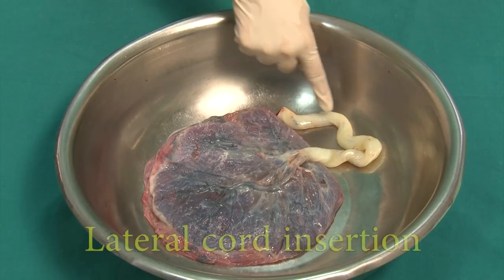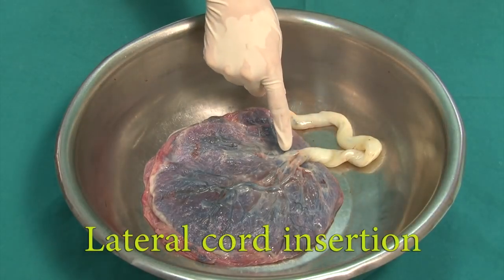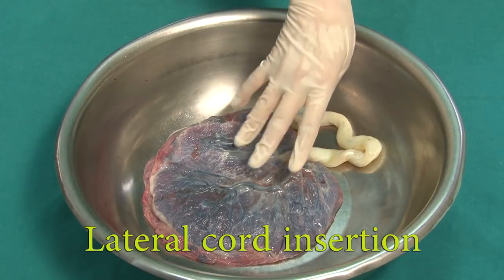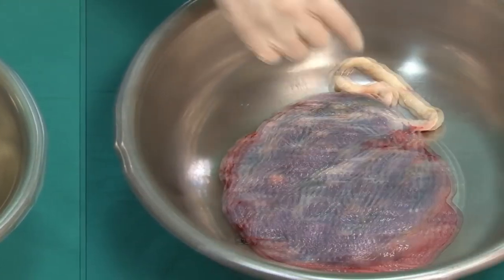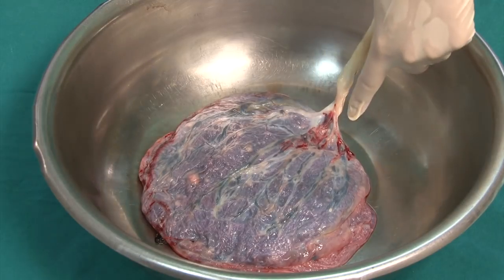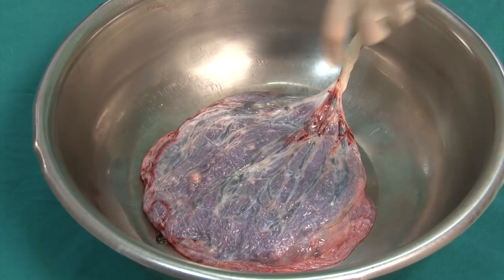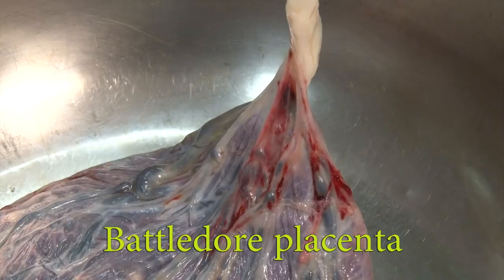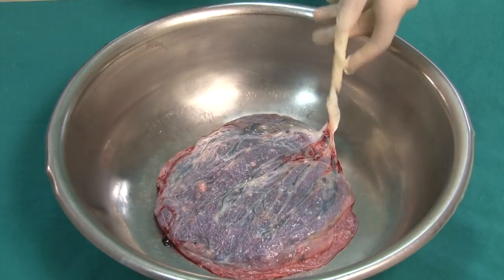This is a case of a lateral cord insertion, which is a variant to the central or slightly eccentric insertion. The vessels from here spread evenly into the rest of the placenta. In fewer than 10%, the insertion of the cord can occur at the margin of the placenta, which is referred to as a battledore placenta. The vessels, when entering the placental tissue, are not protected by Wharton's jelly.